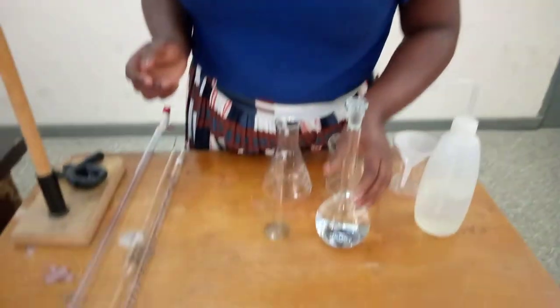So you can see that if you want to calibrate any liquids at all, you need to calibrate at a temperature of 20 degrees Celsius. The reason why we calibrate at 20 degrees Celsius is that from our knowledge of the ideal gas law, especially from Charles's law, we know that an increase in temperature causes expansion, and when there is expansion it increases volume, and what happens to concentration? Concentration will decrease. That is why liquids are always calibrated at 20 degrees Celsius, which means a standard lab is supposed to have a temperature between 20 to 25 degrees Celsius.